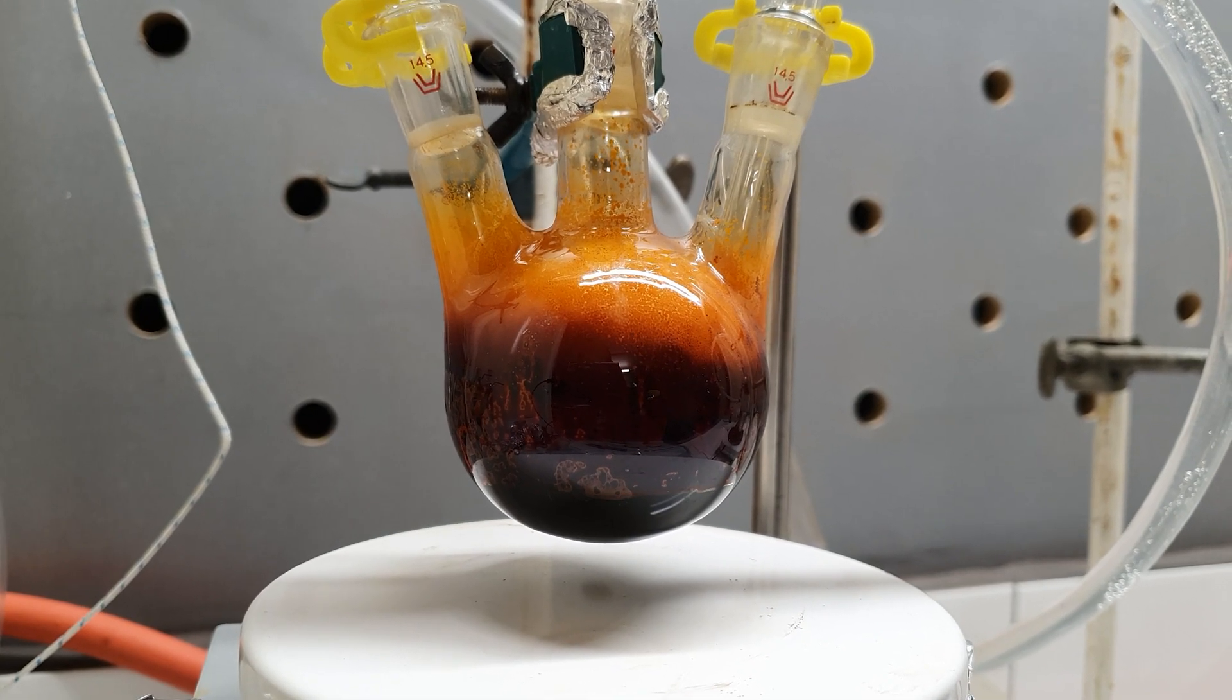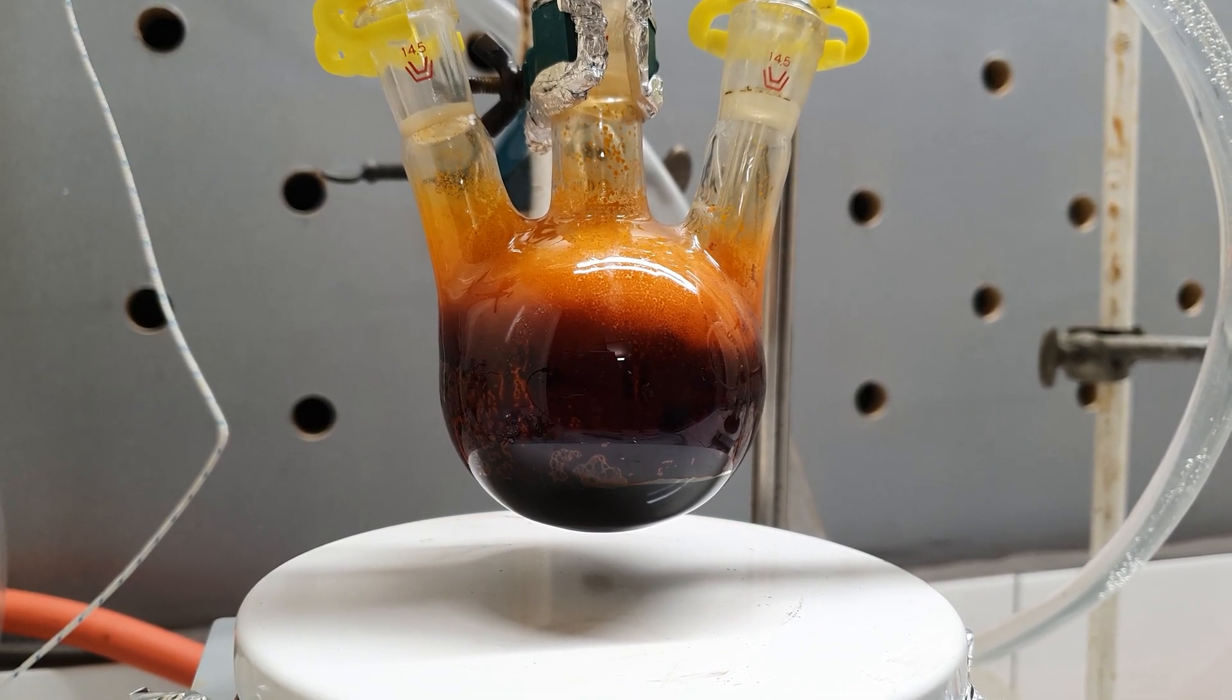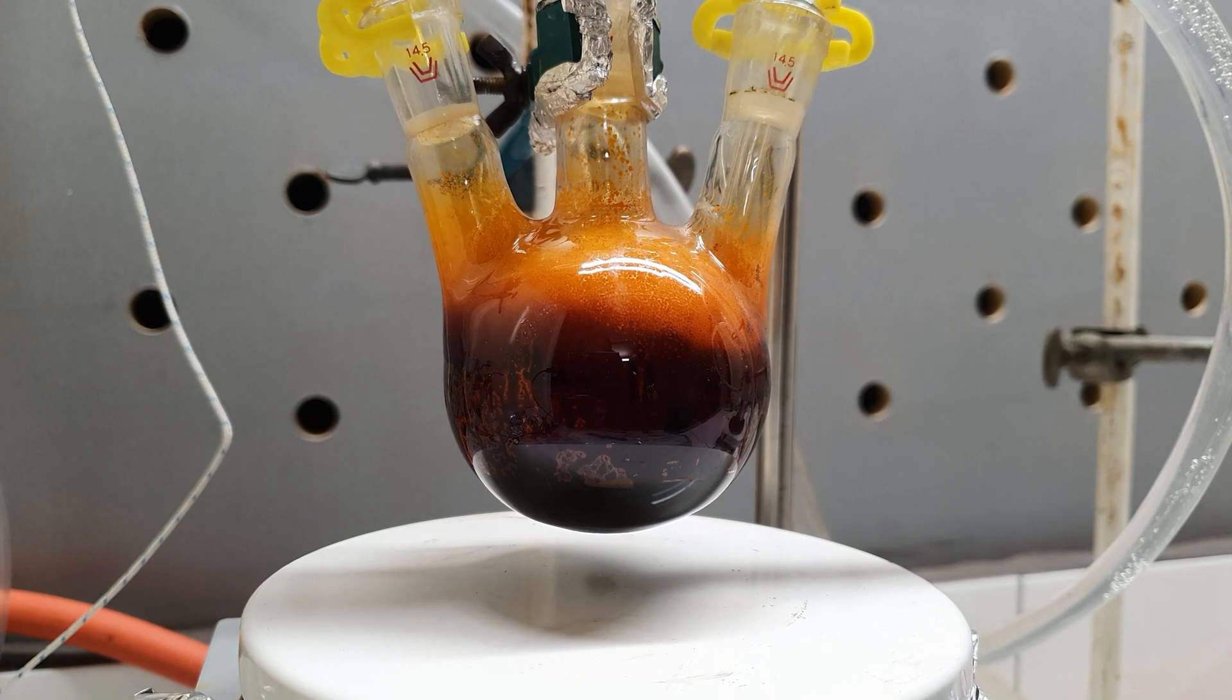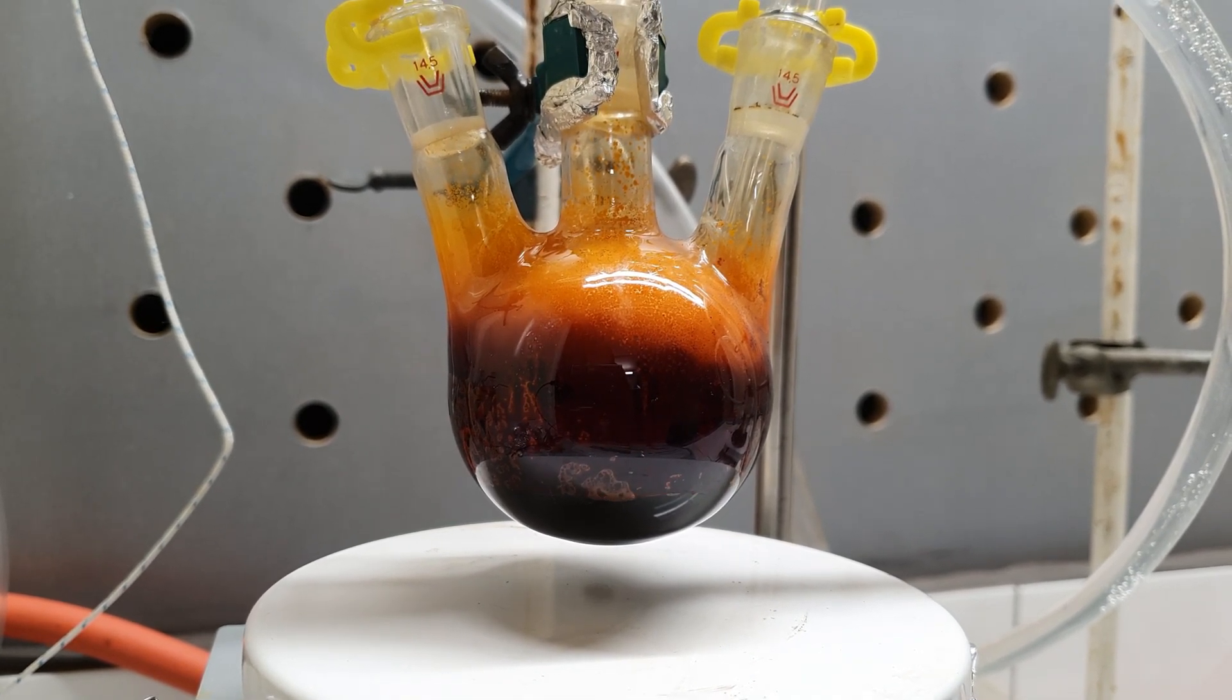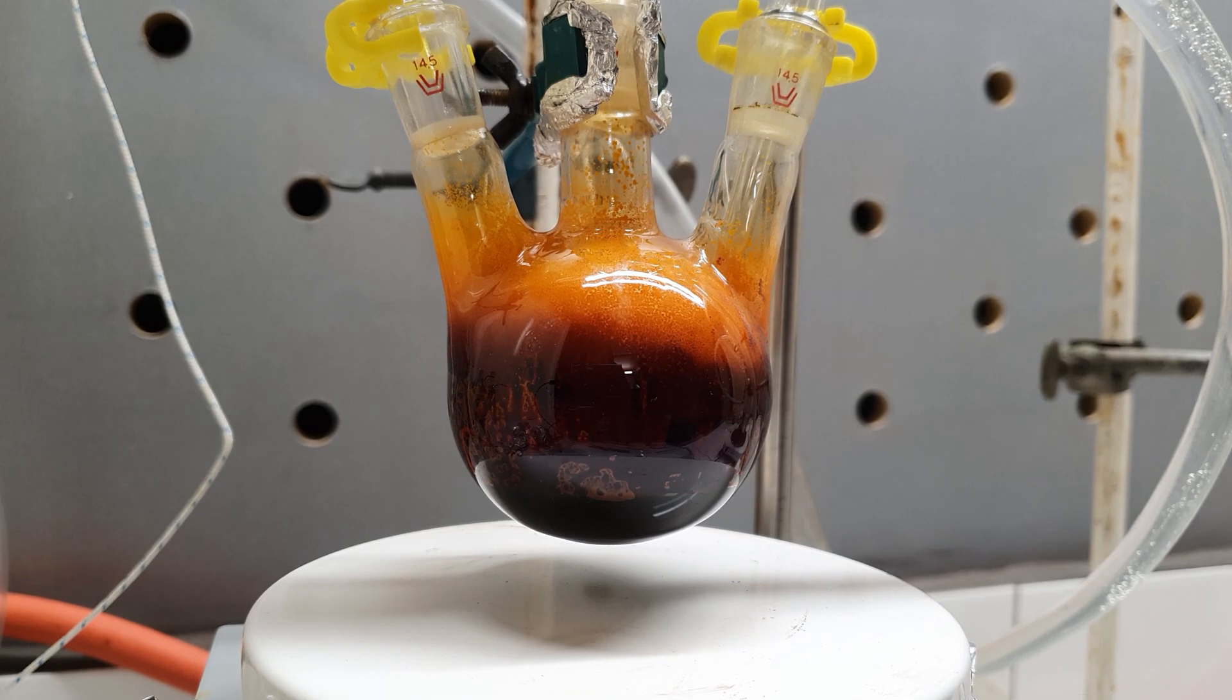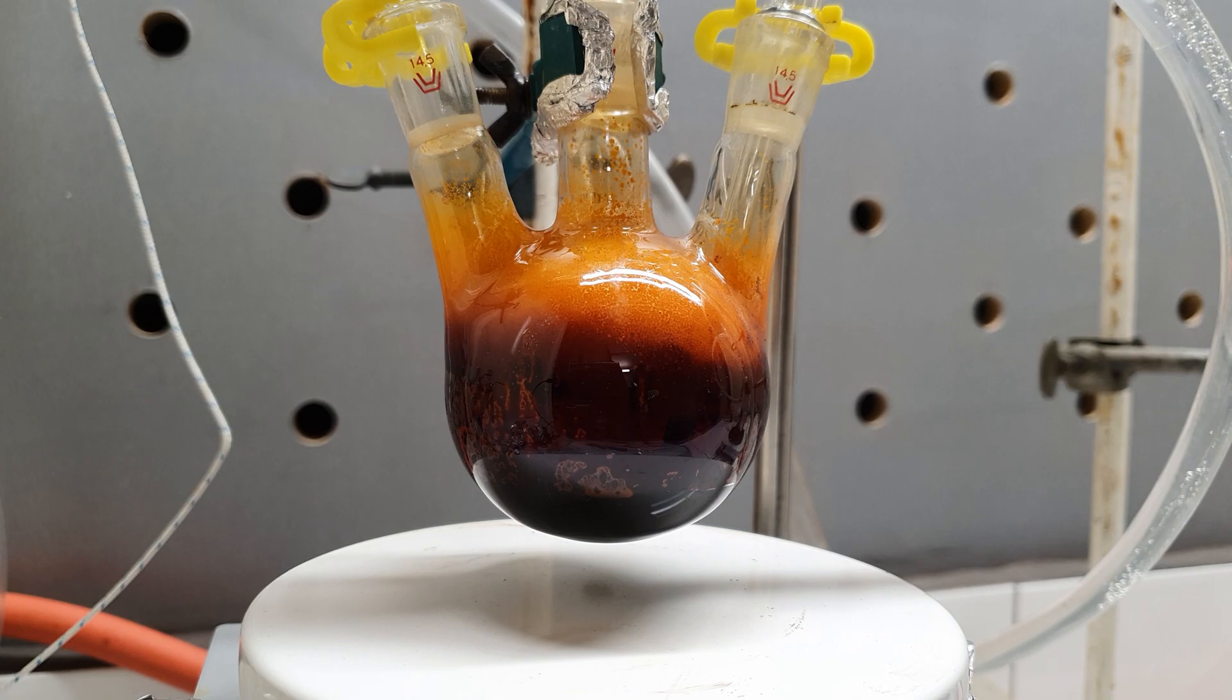One very interesting thing that I noticed while I was editing this video is that in the flask there is a fire. Yep, you heard it. I'm going to slow down the footage so you will be able to see it. This is a flame, ladies and gentlemen. A chlorine one.